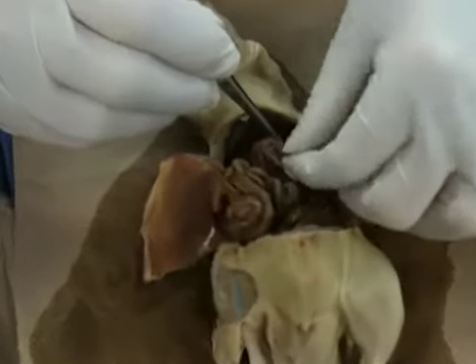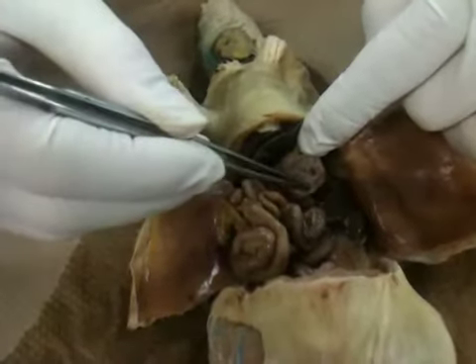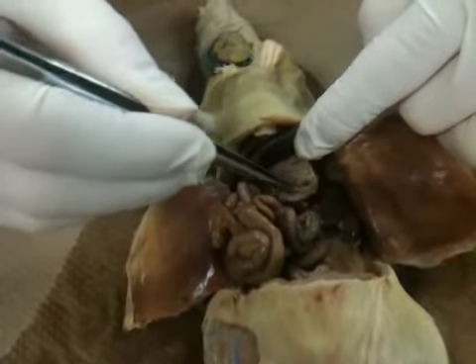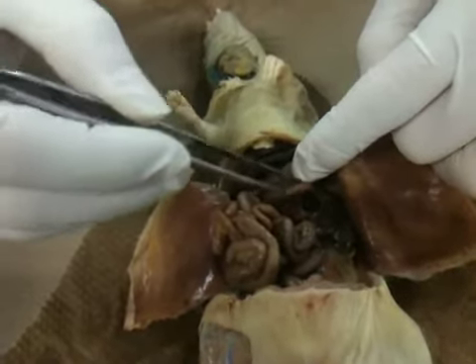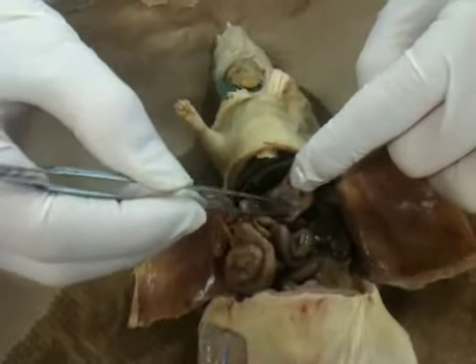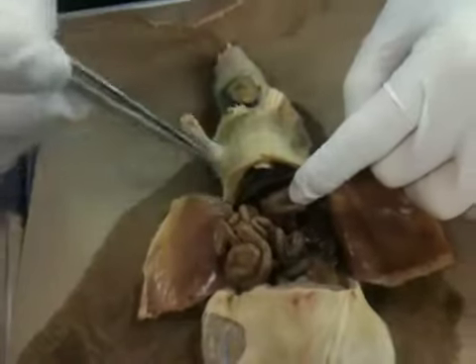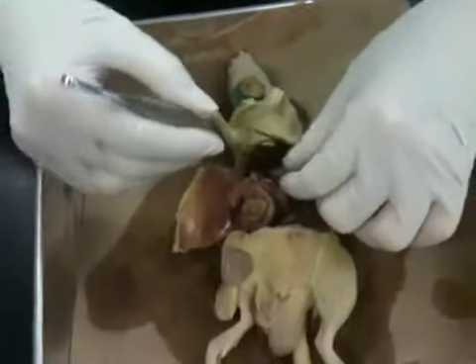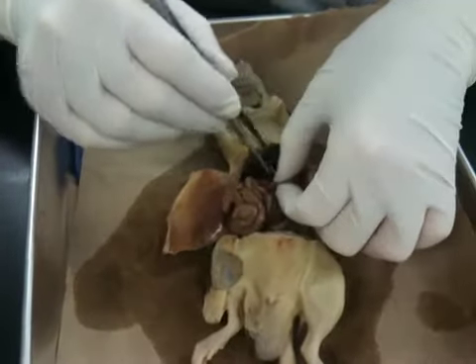This rat did not have anything to eat. You can see these ridges. That's the rugae. Okay, there's the rugae. Those are the ridges that expand. Some of you will not be so lucky. Some of you will have a stomach very, very full. You're going to have to clean out the stomach, so pick it out. That you can throw away, and you may have to wash it out. Just saying.